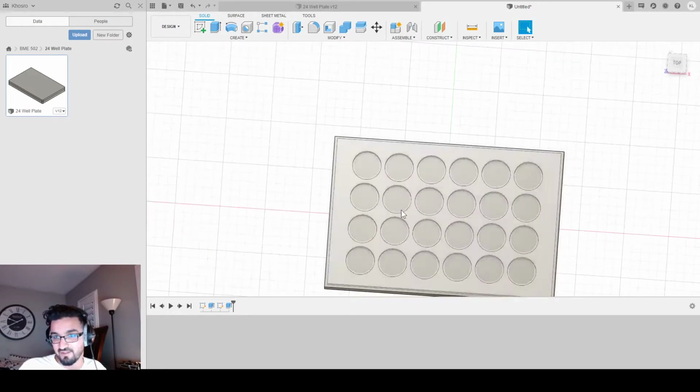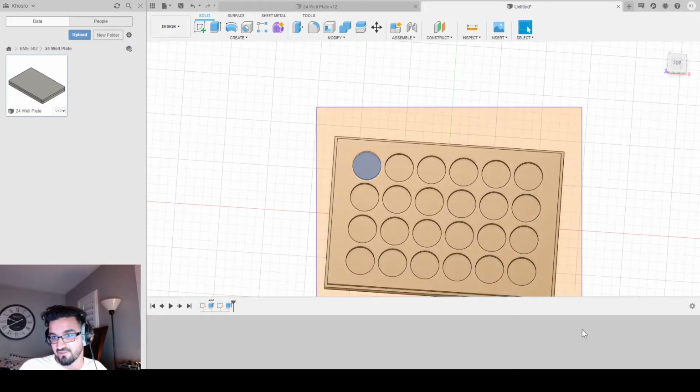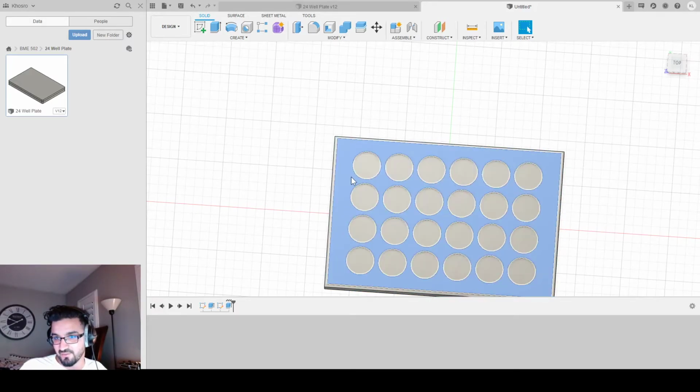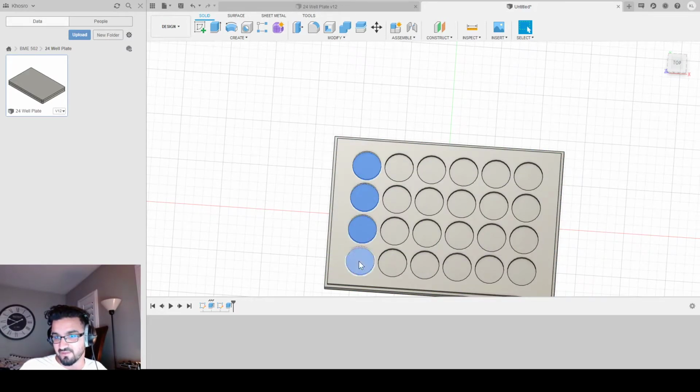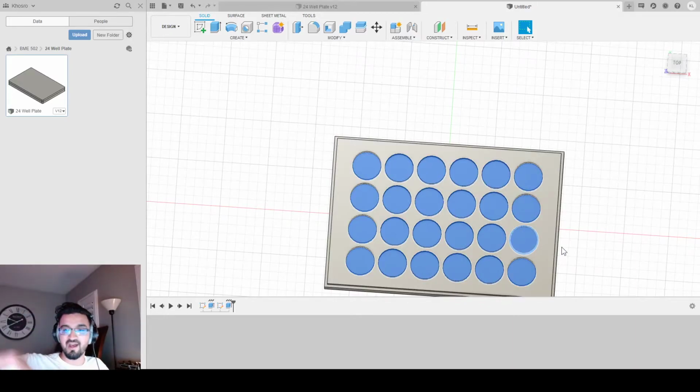Now all I gotta do from here is select one circle and drag. Oh no, it's not working. There we go. Let's select a few circles and drag for the rest of the circles. I guess my drag isn't working the way I want it to, but that's okay. I'm gonna select all these circles. Now I just went up by 3 for the height, right? But I'm 6.8 above the bottom of my plate.